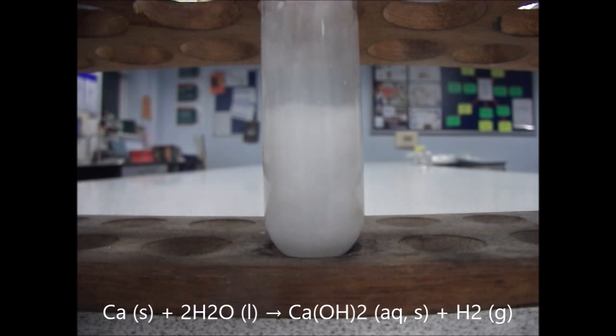So this again is a very exothermic reaction. What's happening is the calcium is reacting with the water to produce calcium hydroxide and hydrogen gas.